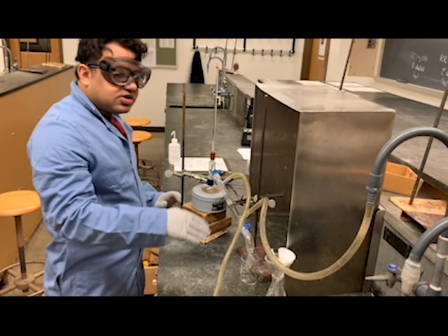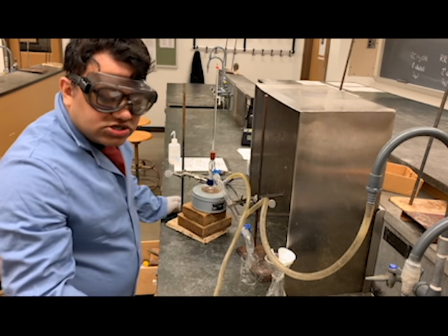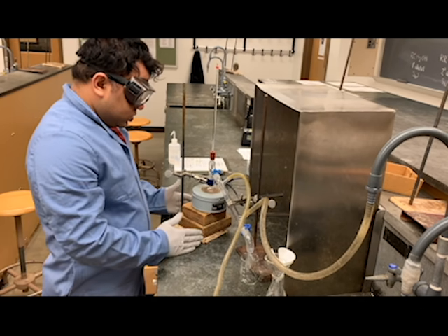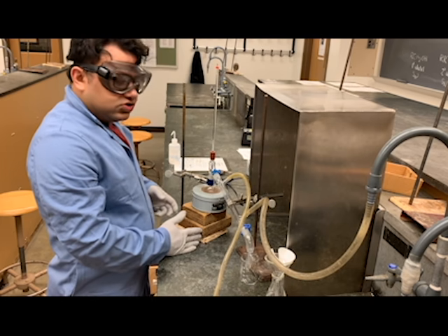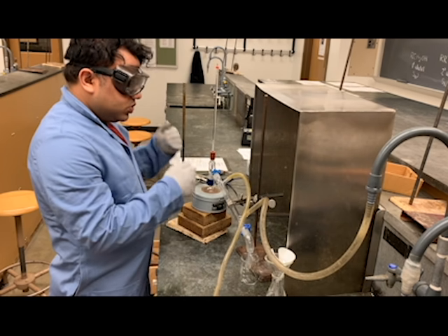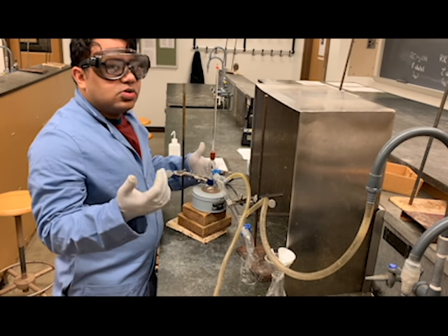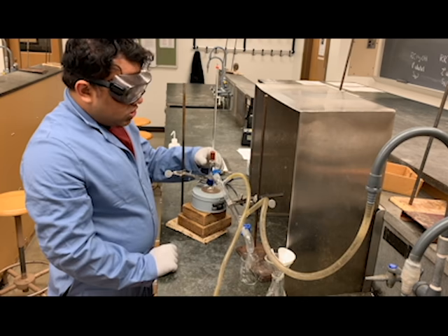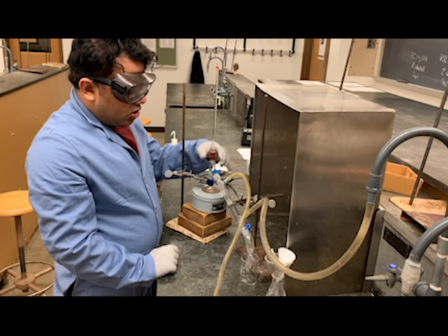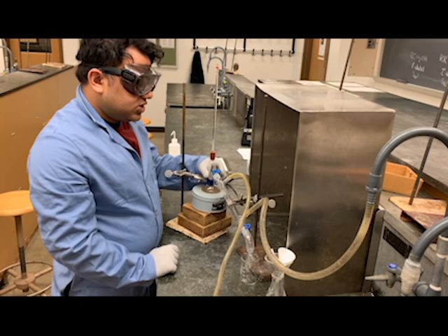We have assembled all our setup for the distillation according to the instructions in our manual. On one stand we're putting two wooden blocks, and on top of that a thermal well on which we're putting our round bottom flask, which has our organic product in it. We're using a 3-way adapter to close the round bottom flask. Make sure it's well greased.